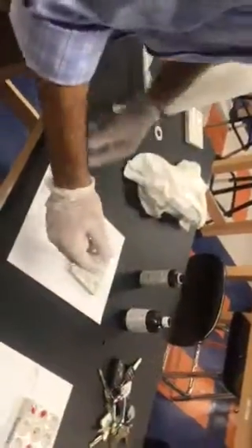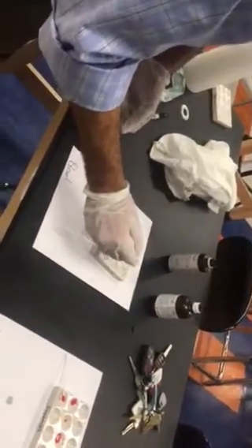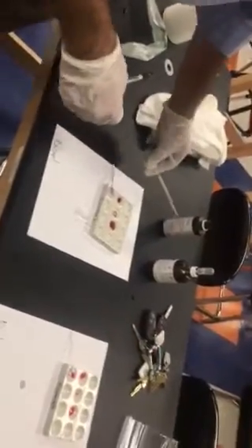So this is called a presumptive blood test because it doesn't tell us what type of blood the substance is, but it does tell us that it's blood instead of something like ketchup, barbecue sauce, red paint, or dye. This is fake blood. So the presumptive blood test will let us know if what we found at the crime scene is, in fact, blood. I'm going to do a presumptive blood test on wet blood. And again, we can see the color change of the blood relative to the fake blood. And so we are sure now that this is some sort of blood. We don't know if it's animal blood or human blood, but we'll do that tomorrow.